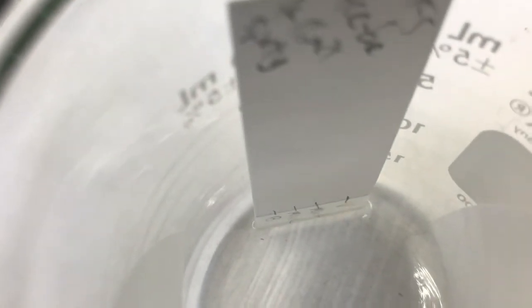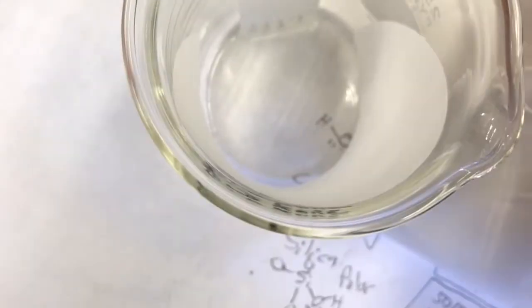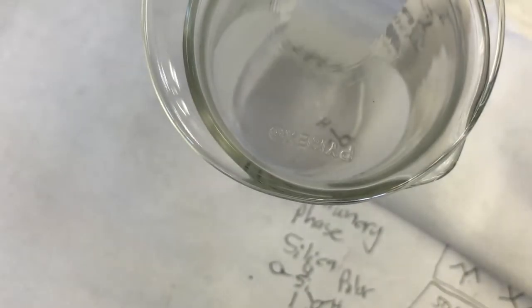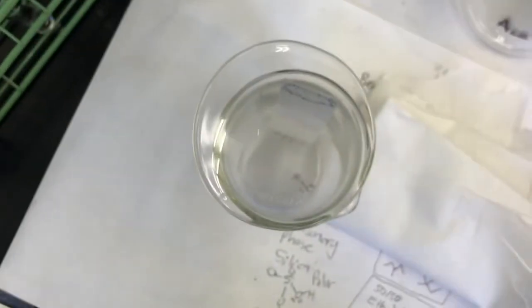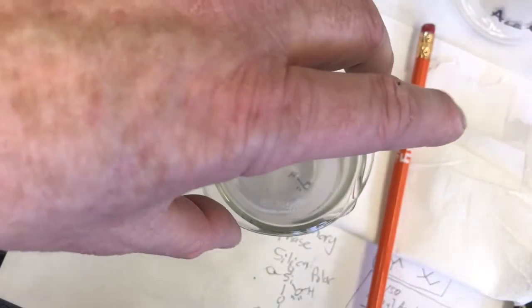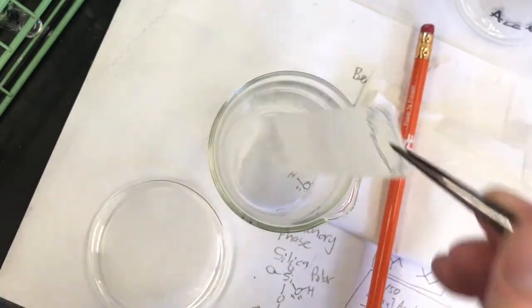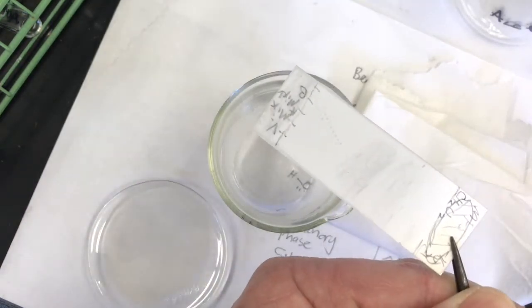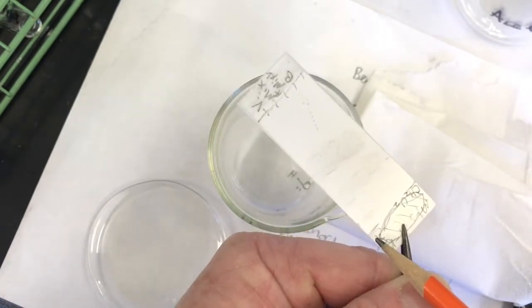It looks like the solvent started below the spots. Yeah, it's climbing up slowly. All right, that one's going okay. Let's cover it up, set it aside, and let's pull out our hexane first run. And remember, when we pull these out, you have to right away label the solvent front because it evaporates. So right away I see it, it's right there. It's right below our last samples. So I put the solvent front line right there.